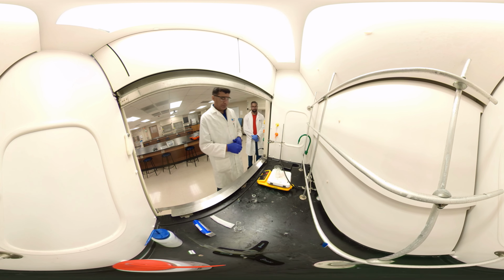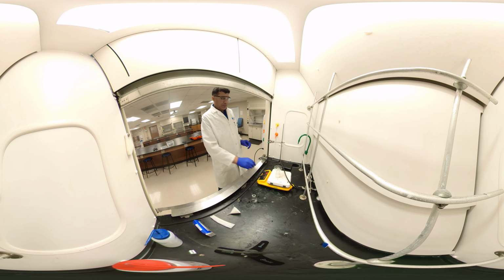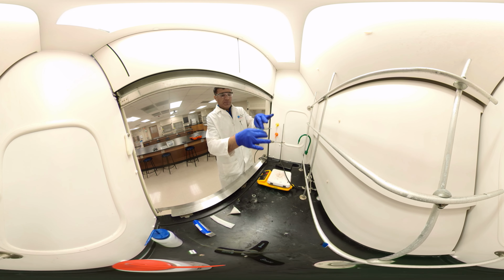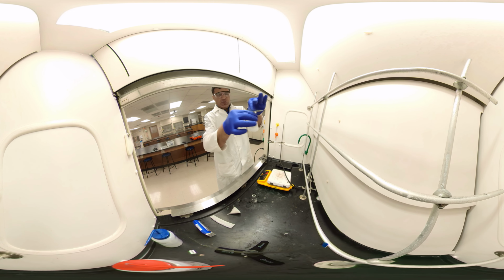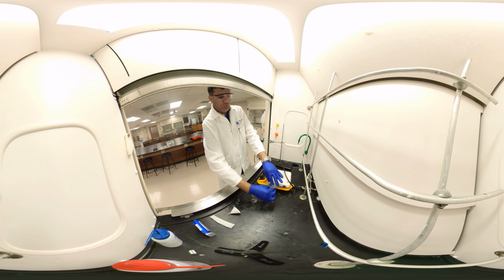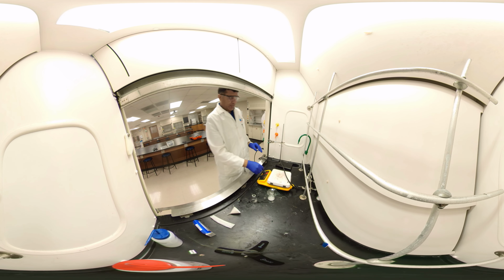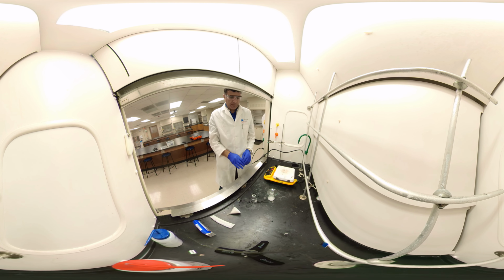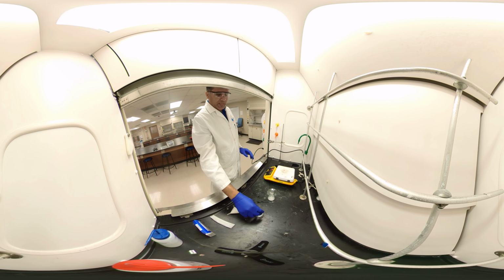It's just heating now. My solution is boiling. See, it's boiling, it's very hot. Most of it dissolved, but I can still see some solid there. Okay, I'll let it cool down for a while as we are handling things. I keep my hot plate here. Just be careful, okay? Don't touch the surface of the hot plate. It's really hot. Leave it there on. We need it later. So we're just cooling down.